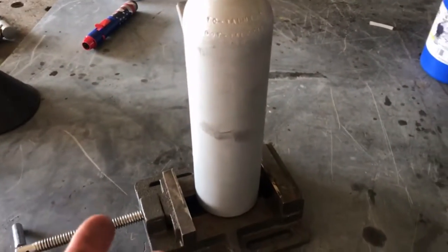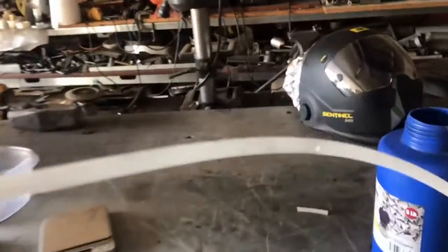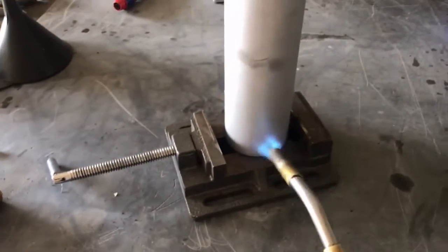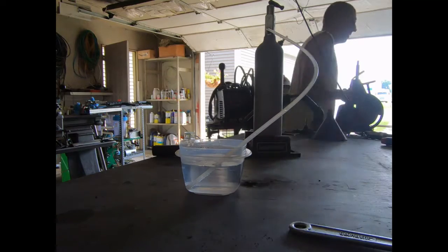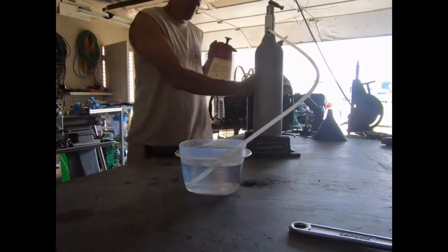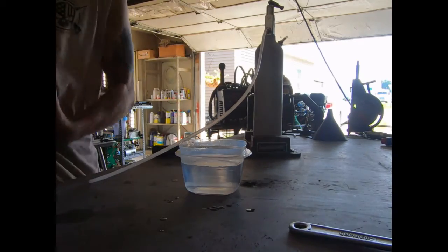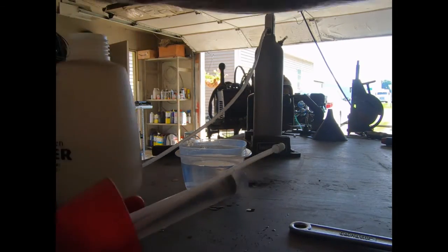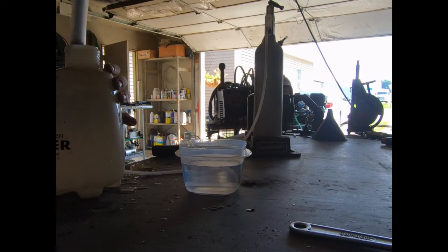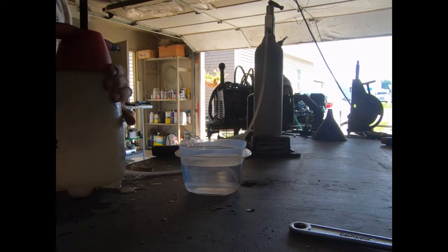So that increase in weight we've seen very well may have just been moisture — I don't know that I would say there was a gram of moisture absorbed. My hose started to melt, so I had to run and grab a spray bottle, which turned out to be empty. But there is another nail in the coffin for this idea: the amount of heat you have to dump into this thing to get a reasonable temperature is crazy. To get any bubbles at all, we are cranking way more energy than we would ever get out under these circumstances.